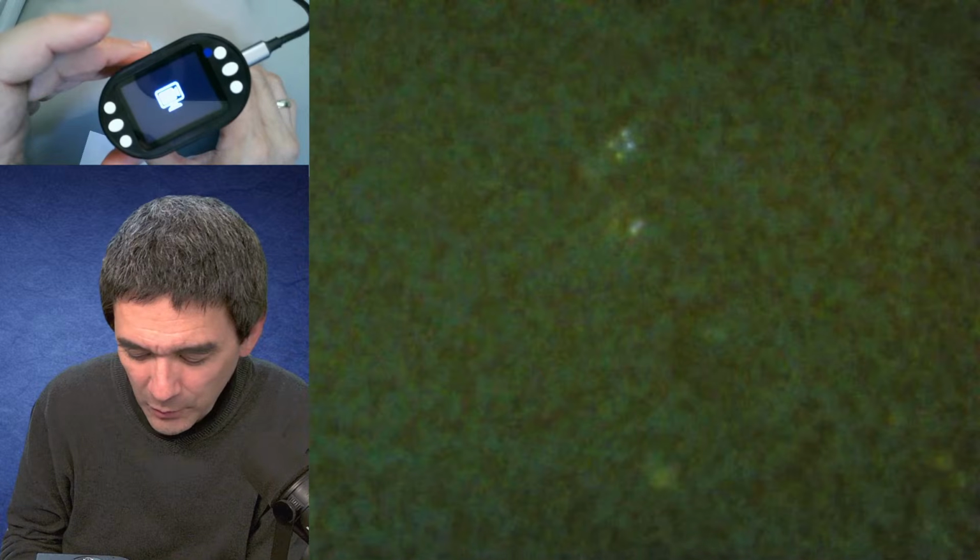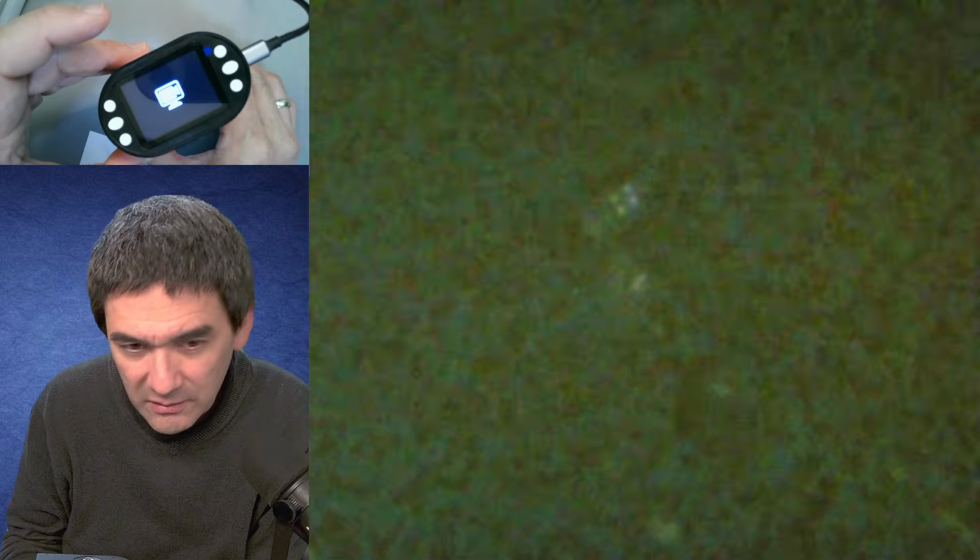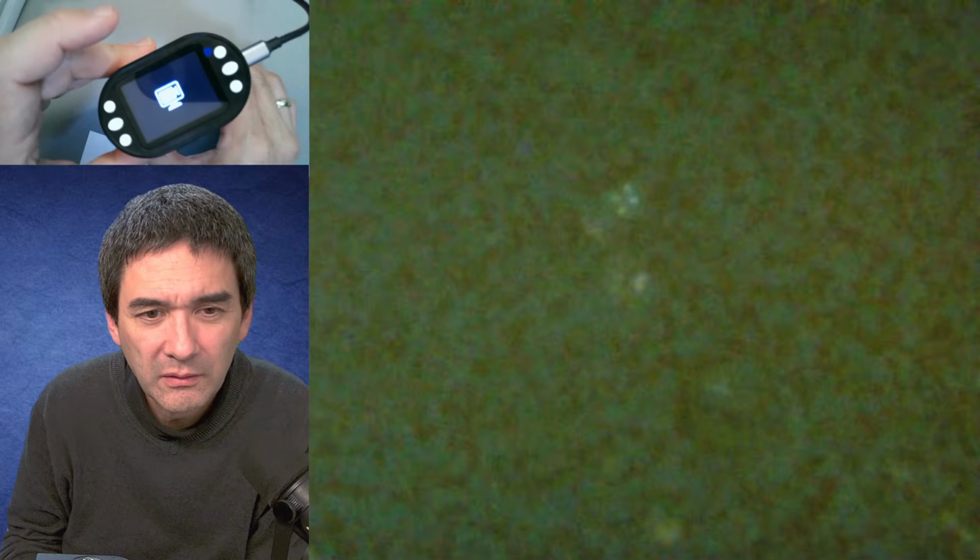Ta-ta! Happy. But the problem is if I go up more with the light, then I'm kind of worried that it's going to disconnect again. Focusing is difficult. So that's the best I can get. Okay? So that's my blood under the microscope using the USB microscope. Yeah? Yeah. So that's not a lot of, how do you say, not a lot of detail visible.